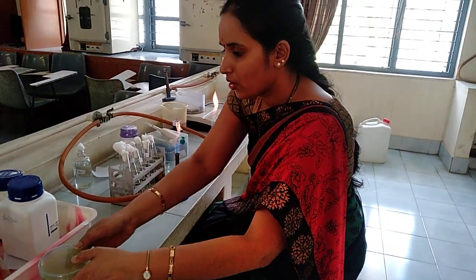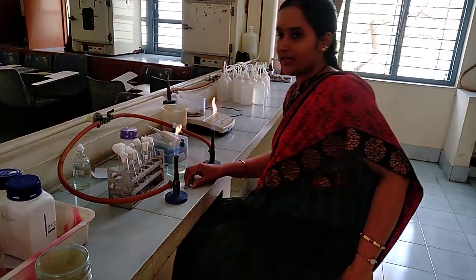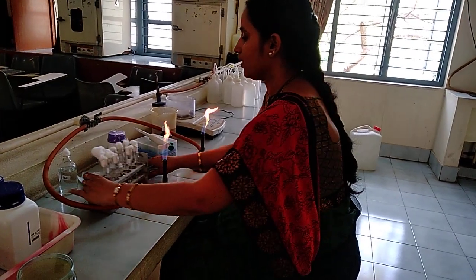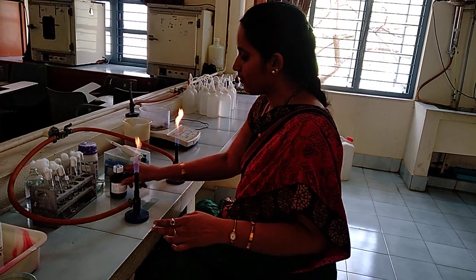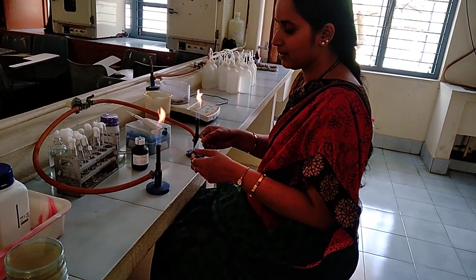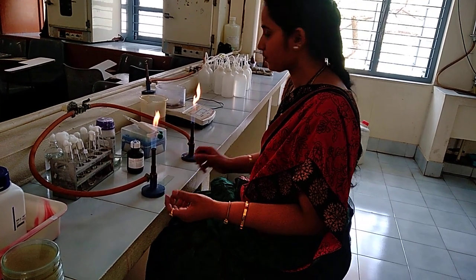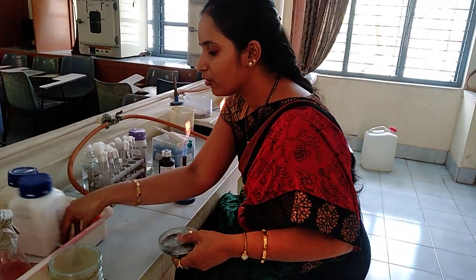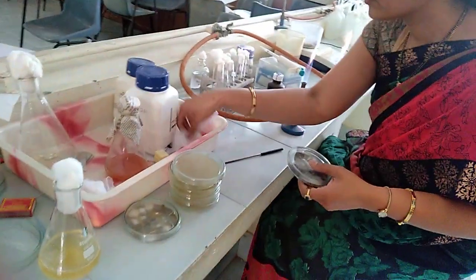Now I will show how to stain the fungal cultures and observe them under the microscope using the lacto-phenol cotton blue stain. For that, take a clean glass slide and take the fungal culture using the inoculating loop.